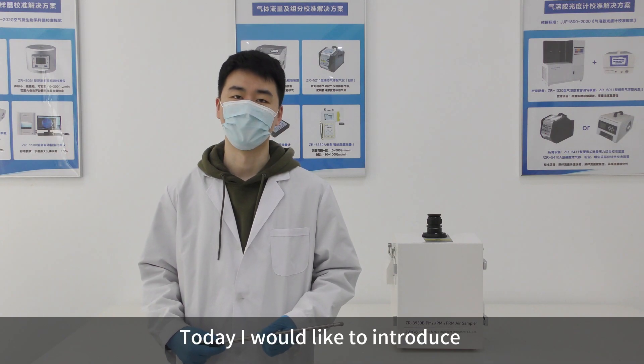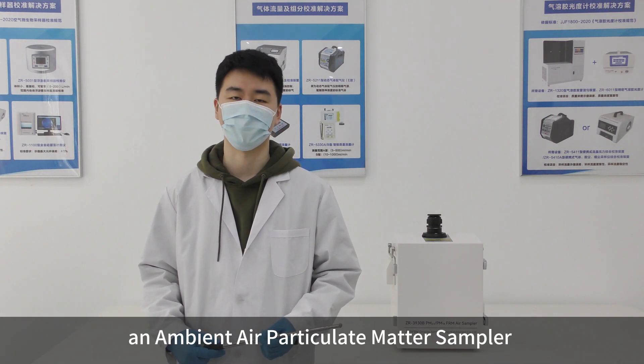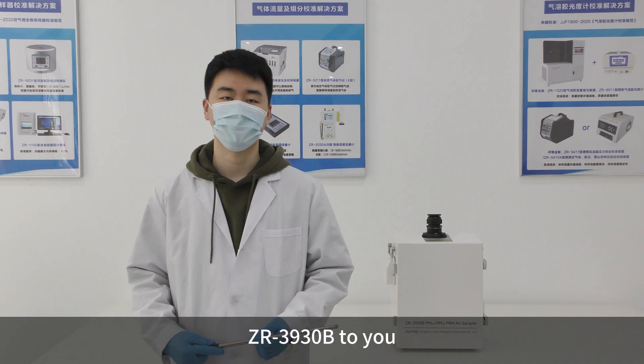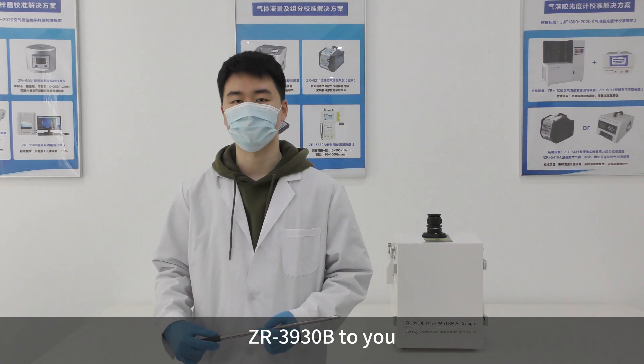Hello everyone. Today I would like to introduce an ambient air particulate matter sampler, ZR-3930B.